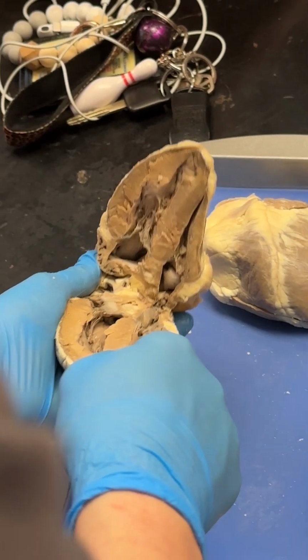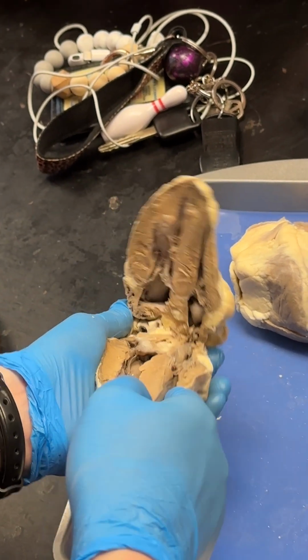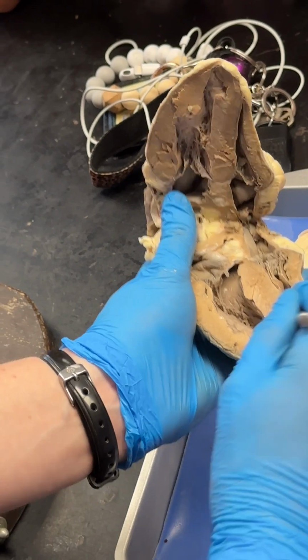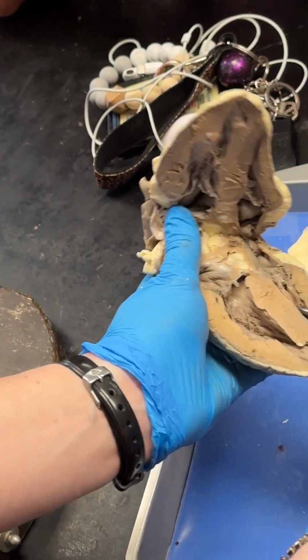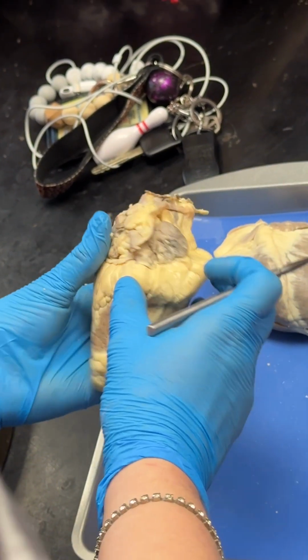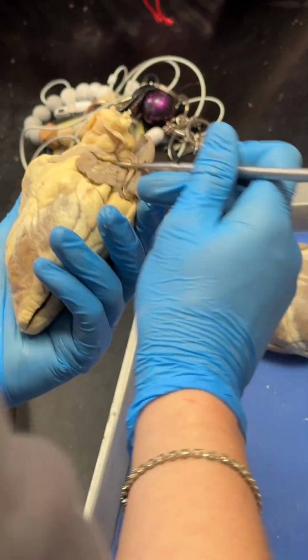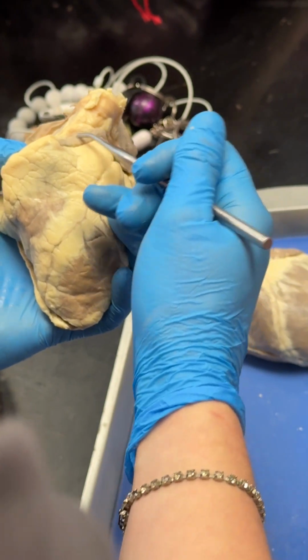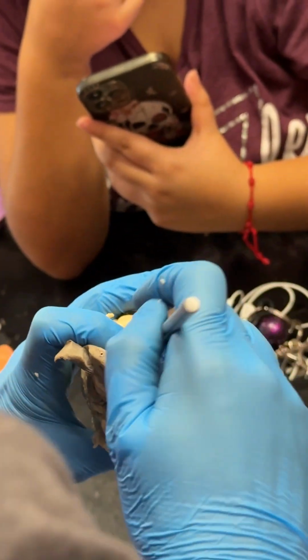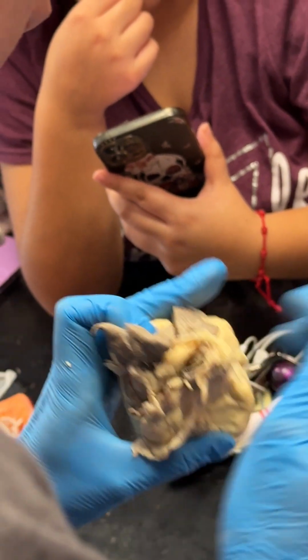This one is very deep inside the right ventricle. Y'all might have to take my word on this one, but if you had very carefully been able to get the probe all the way up in there, it would pass through the pulmonary semilunar valve and come out this pulmonary trunk here. Where's the opening to the trunk? Let's see if I can.